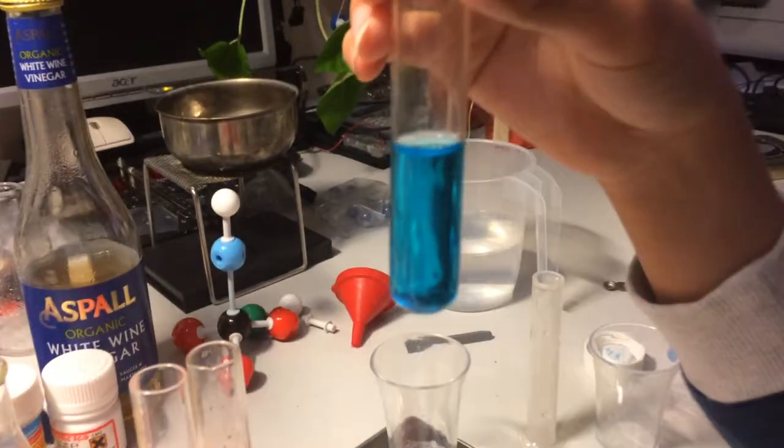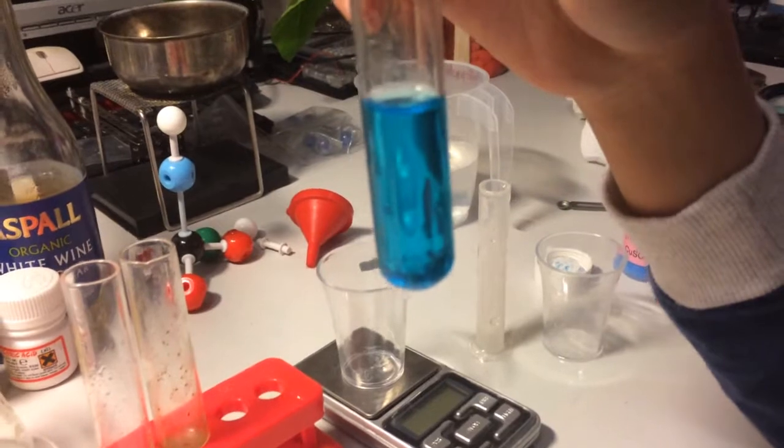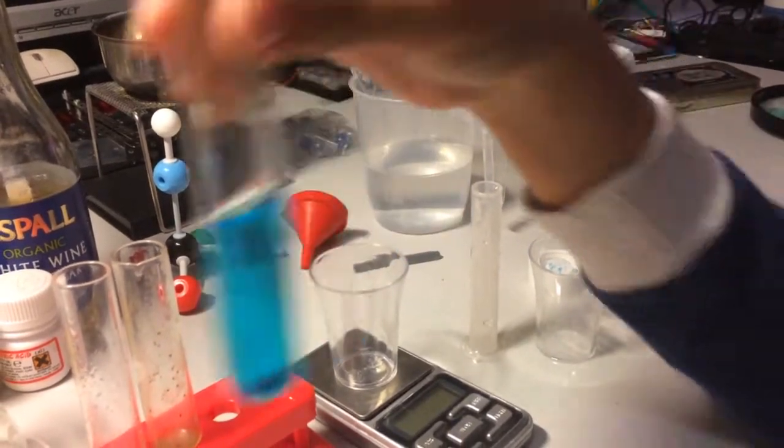Now that the copper sulphate has dissolved into the water, we can now continue with the experiment.